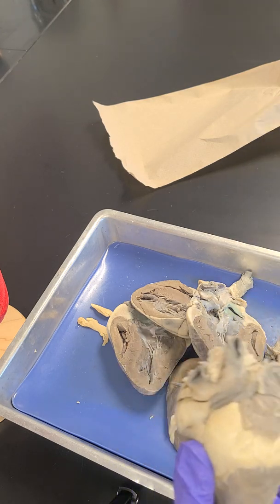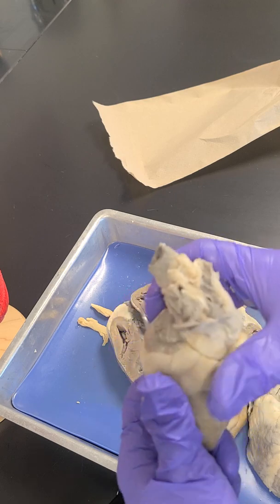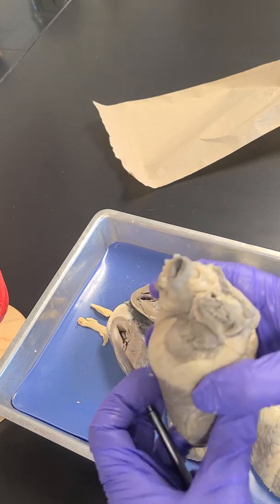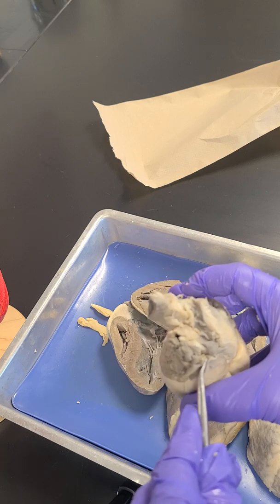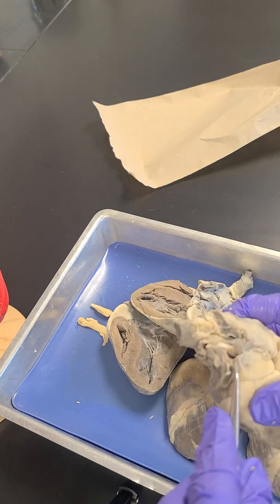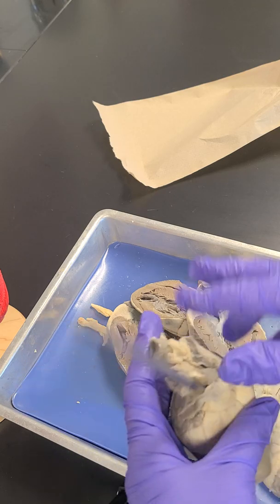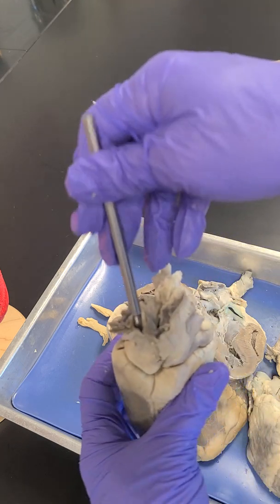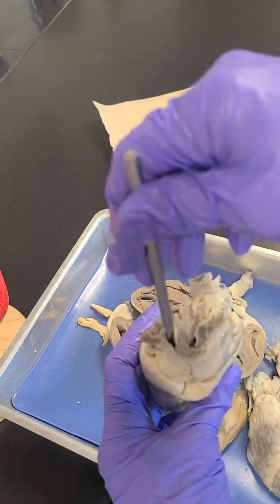And then our last vessel, so orient yourself. This was the front of the heart. I'm flipping it over to the back, kind of on the side. And then this is my last vessel right here, the last one that I need to do. This is it from this view.